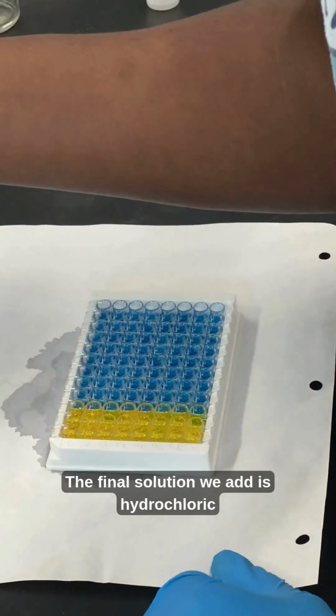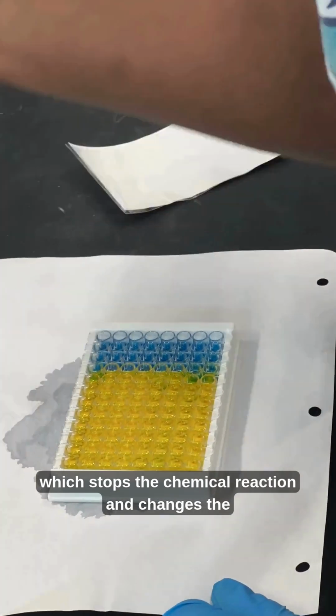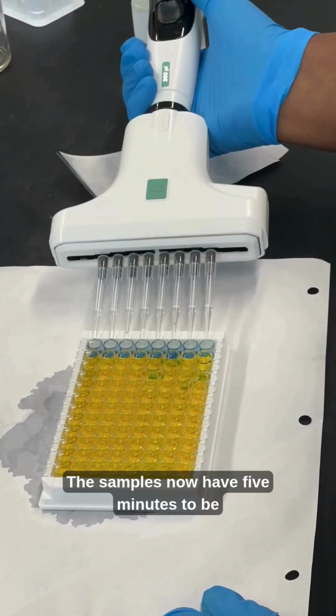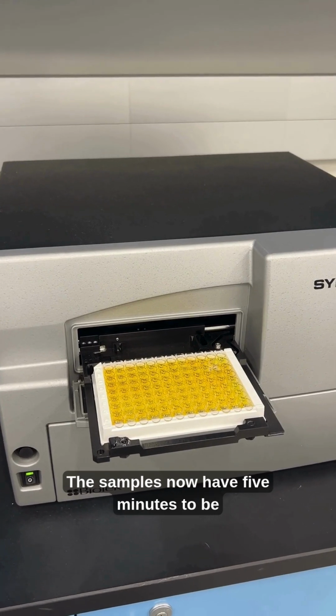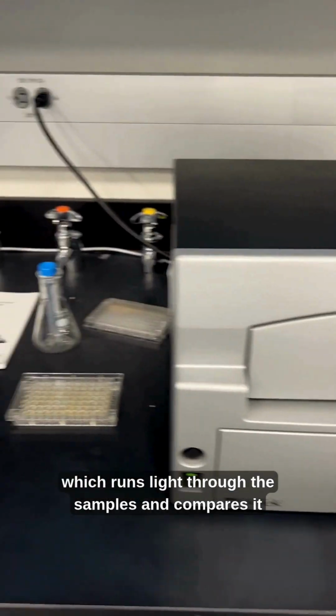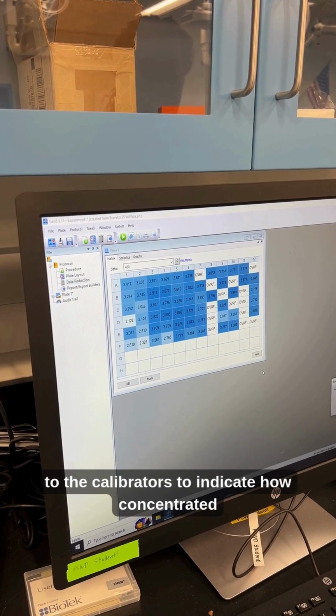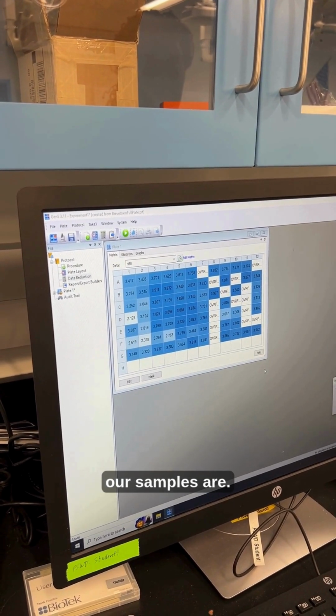The final solution we add is hydrochloric acid, which stops the chemical reaction and changes the color to yellow. The samples now have 5 minutes to be measured for absorbance using the assay machine, which runs light through the samples and compares it to the calibrators to indicate how concentrated our samples are.